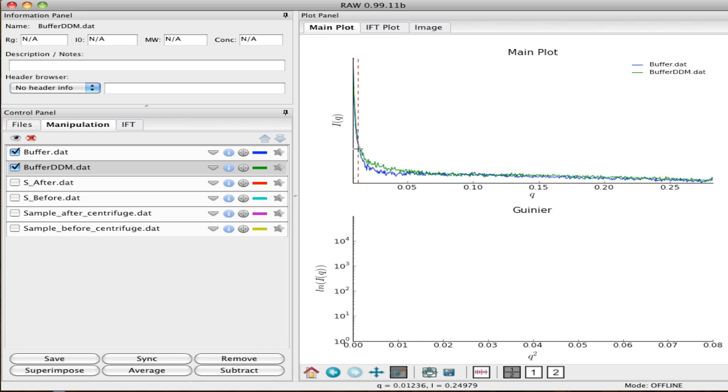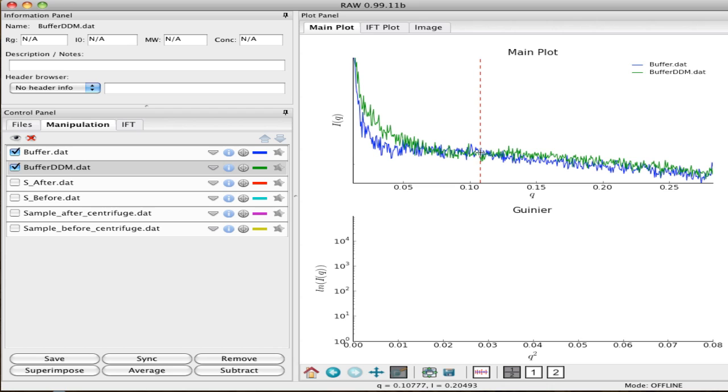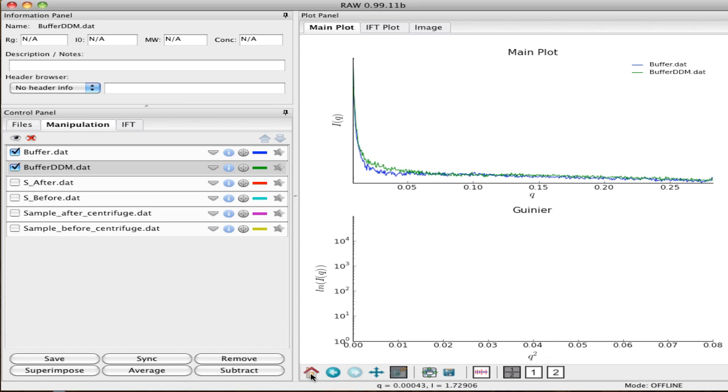I'm going to zoom in a little bit just so you can see the difference more clearly. This is a very dilute solution and you really can't see it very well, but you'll notice right there that the curves don't quite cross, but the micelle sort of kisses the curve here and then rises up again. So that's very characteristic.